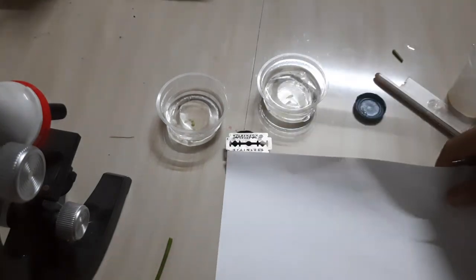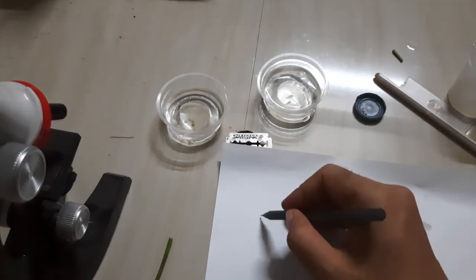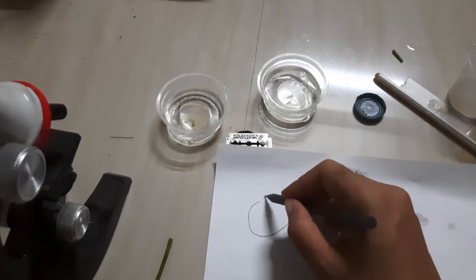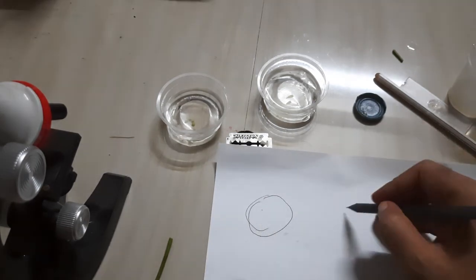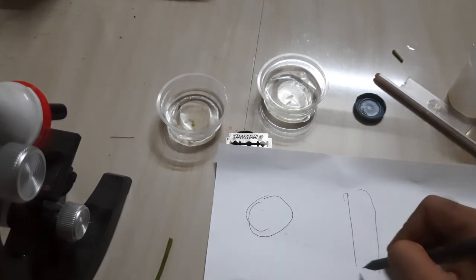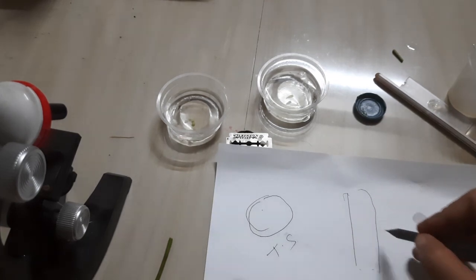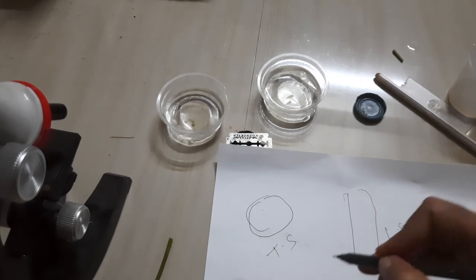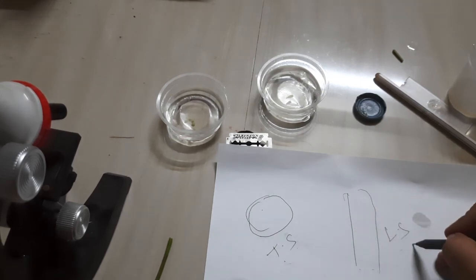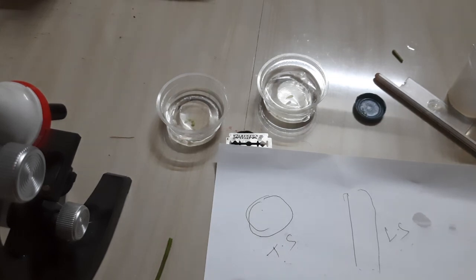So like that way we have to prepare transverse section and longitudinal section. Generally, transverse section will look like this. Thank you.